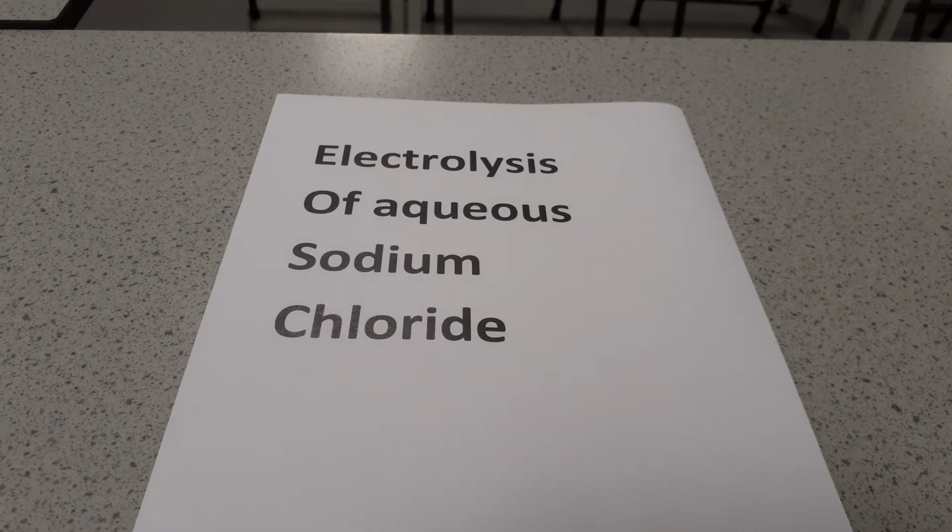In today's video we're going to look at the electrolysis of solutions. In the first case we're going to look at the electrolysis of sodium chloride, and then we will look at the electrolysis of copper sulfate.